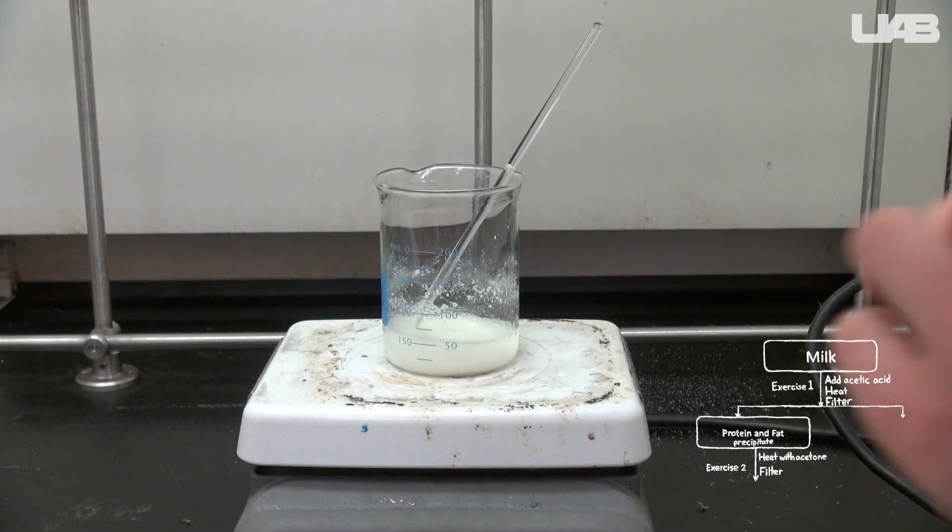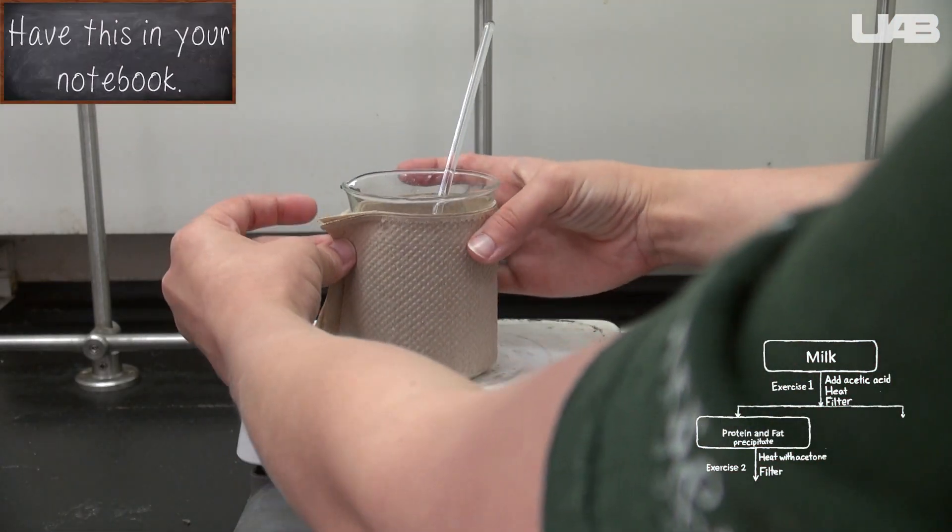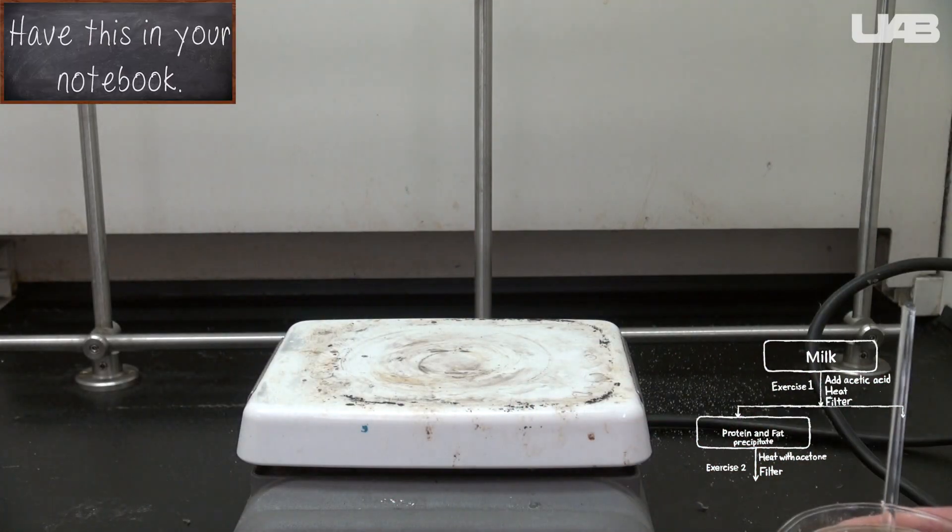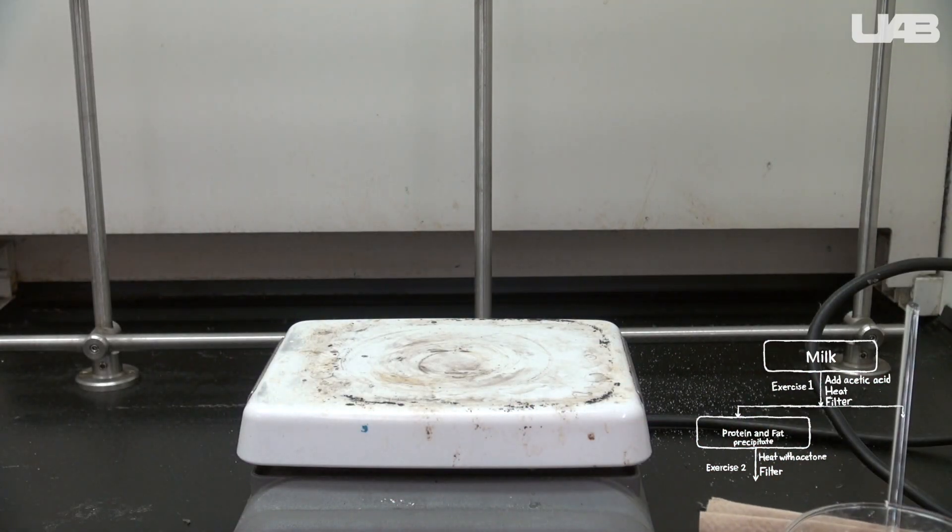Once the solution comes to a boil, you should take it off of the hot plate using a paper towel, not your bare hands. It'll be hot, and let it cool for two minutes.